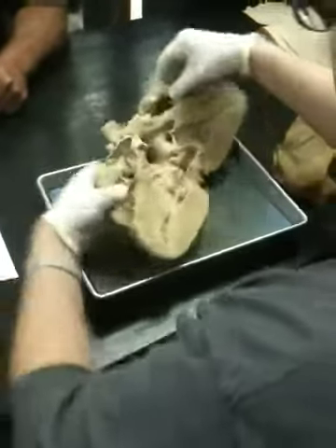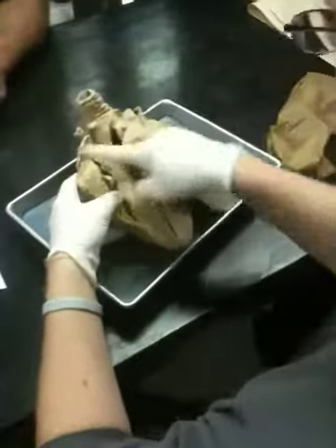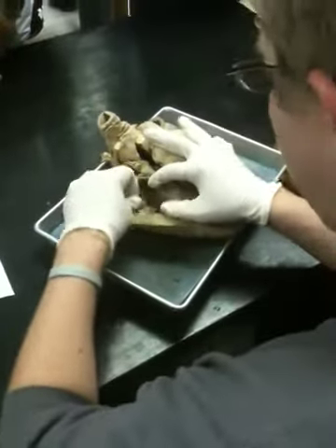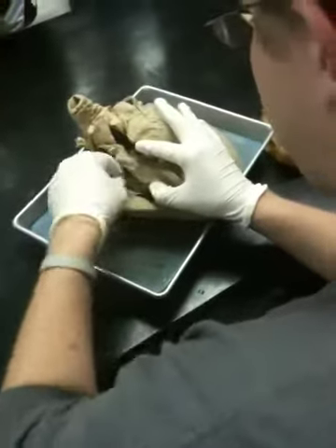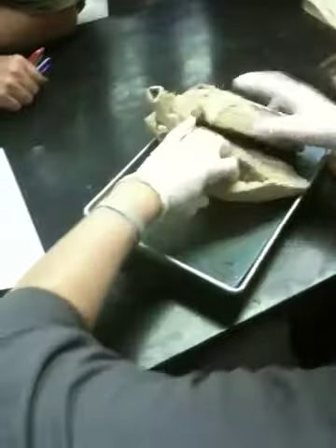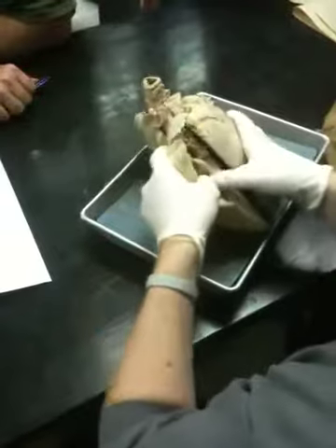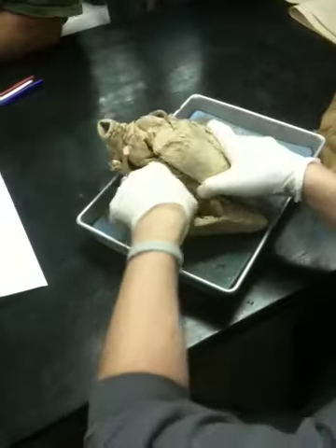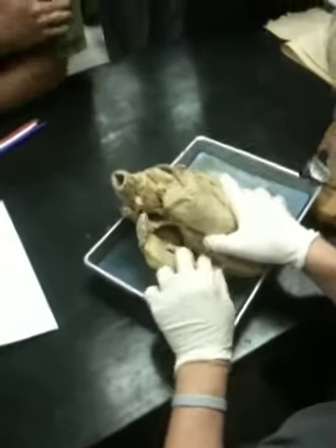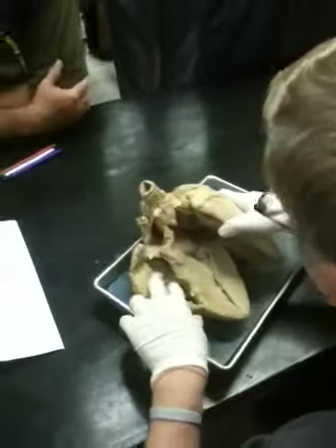If you open it up, you can see the atrium and ventricles a little bit better. Over here, we're going to have the right side. Everything above these tendonae, these are called chordae tendonae, is going to be your atria up in here, and everything below that is going to be your ventricles down in here. The tendonae are these fibers coming off of the atria, running into the ventricles. Chordae tendonae, and they come off of this atrioventricular valve.